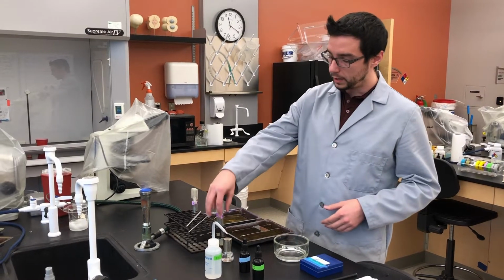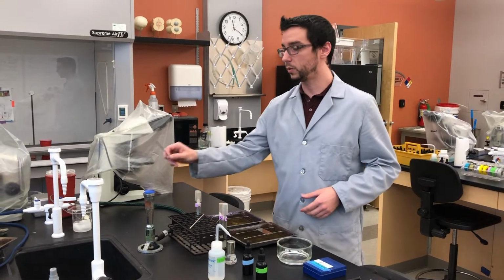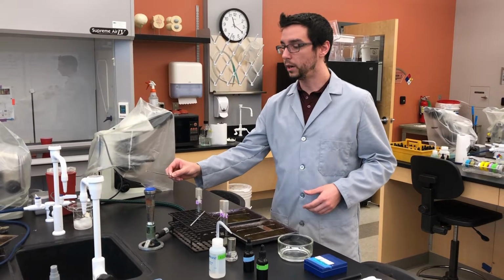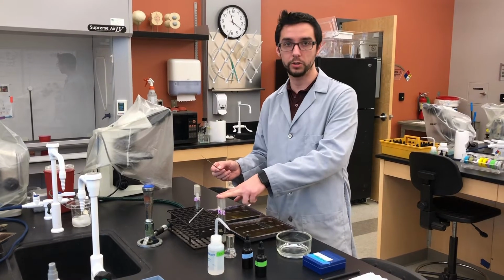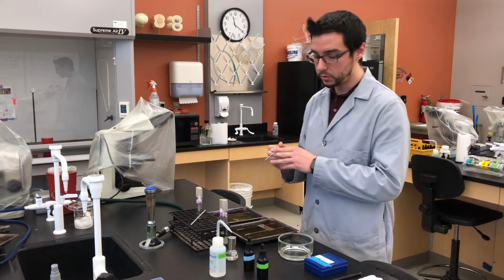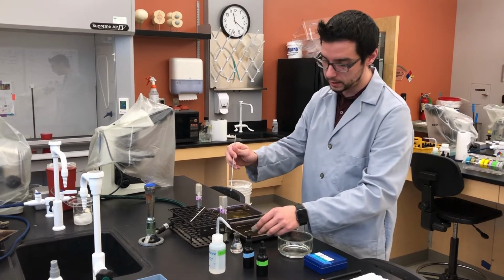And then, because we're coming from a slant, the first thing we are going to want to do is to get water onto the slide for the formation of our smear, because these are solid cultures, just like when you pulled from the agar plate. You need to use sterile water to serve as the mixer.